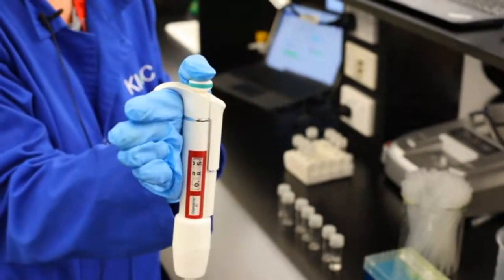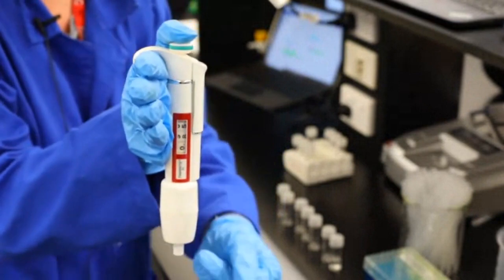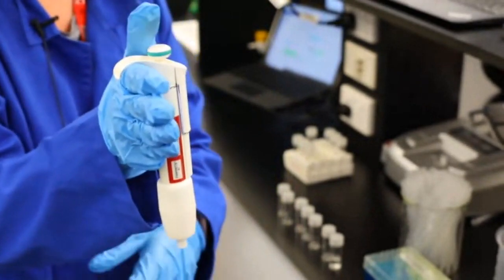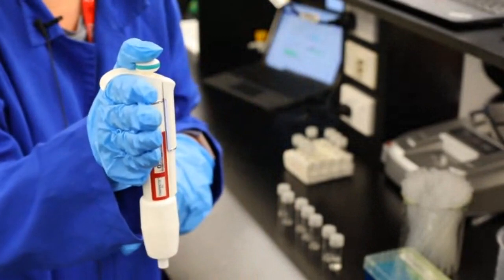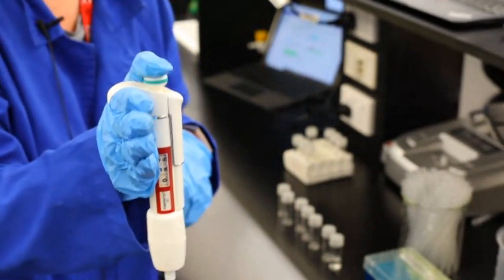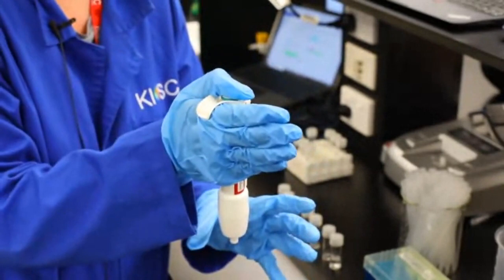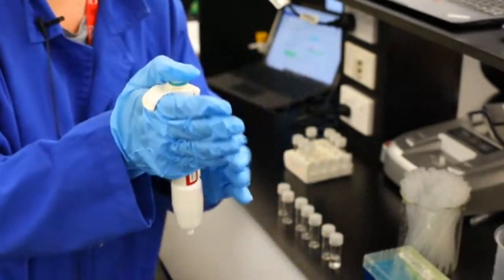That pushes all the air out, and then when you've got your little tip on the end, or in this case the big one, it pushes everything out completely. And then when you go to put that liquid somewhere else, you push it all the way down to the bottom. That's what we call our second stop, and that pushes everything out. Now when you put that into your container, you need to make sure it's pushed all the way down to the bottom, and then you don't release it while it's in there, otherwise you'll start sucking everything in.